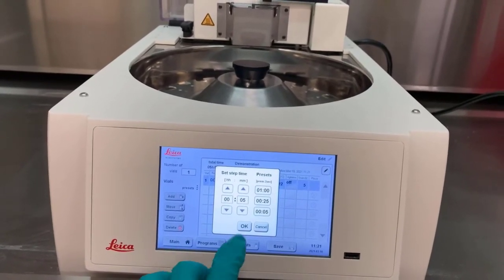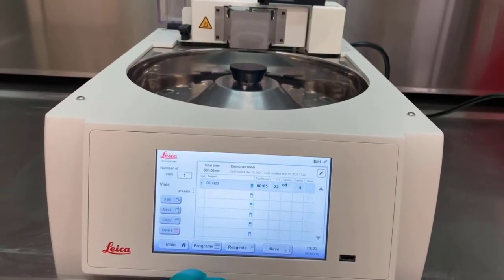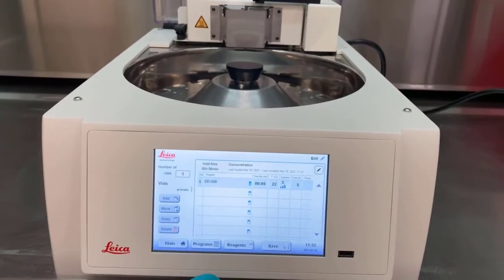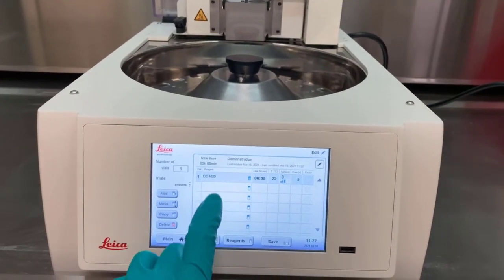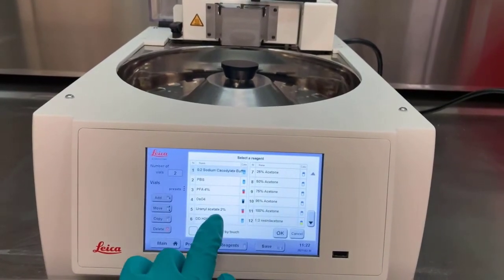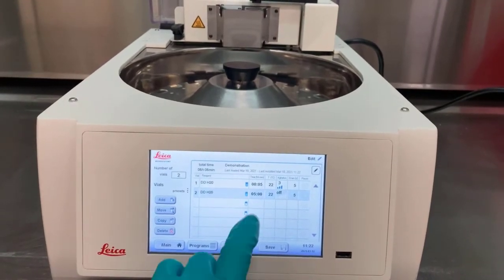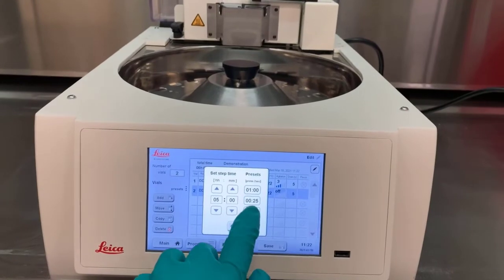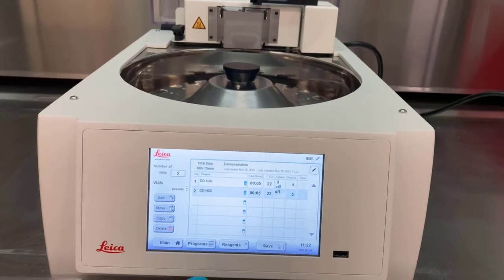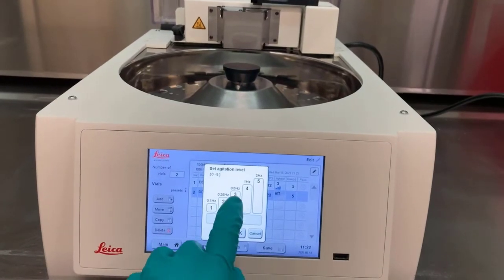The presets can be helpful for quickly changing options. Each of the columns is a different variable. Agitation is one example. This will be active throughout the entire step. Adding another step can be as simple as clicking the blank step and selecting the new reagent. The time as a default for hours or minutes should always be carefully considered to make sure it fits for the sample.